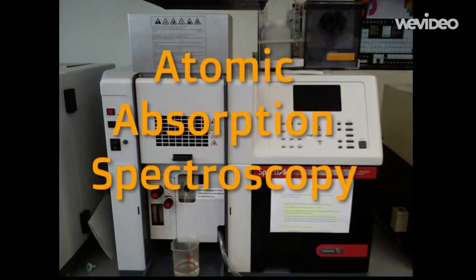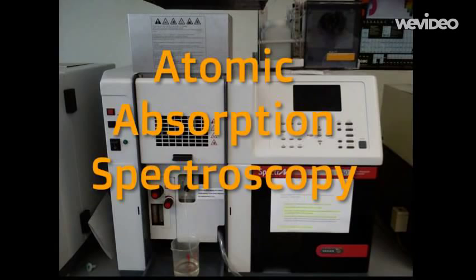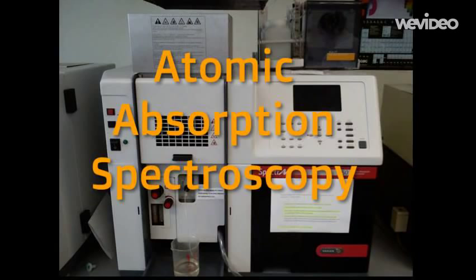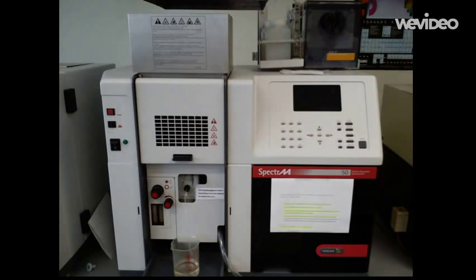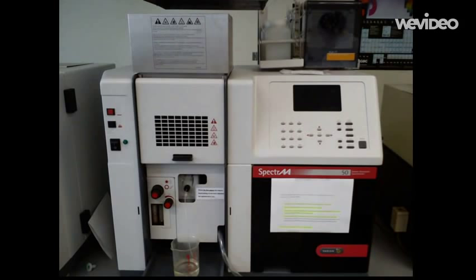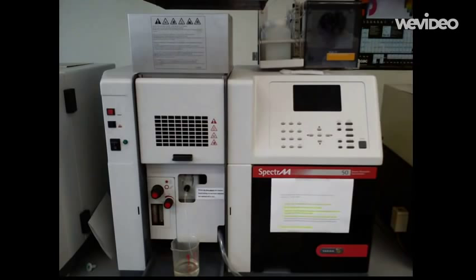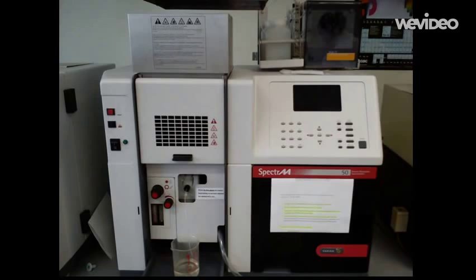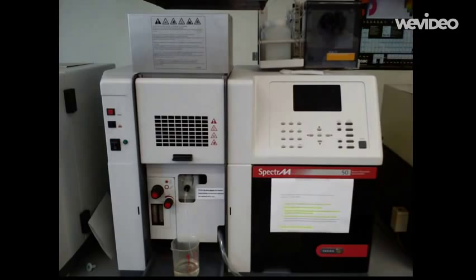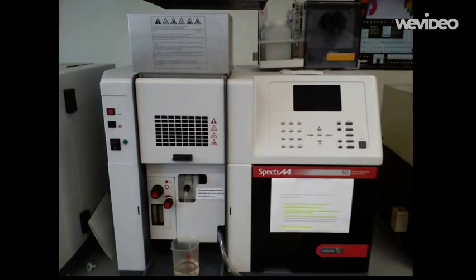Atomic absorption, more commonly known as AA, is a determination of the presence and concentrations of metals in liquid samples. Typical concentrations range in the low parts per million range. In atomic absorption spectroscopy, light of a specific wavelength is passed through the atomic vapour of an element of interest, and the measurement is then made using the intensity of light as a result of the absorption.